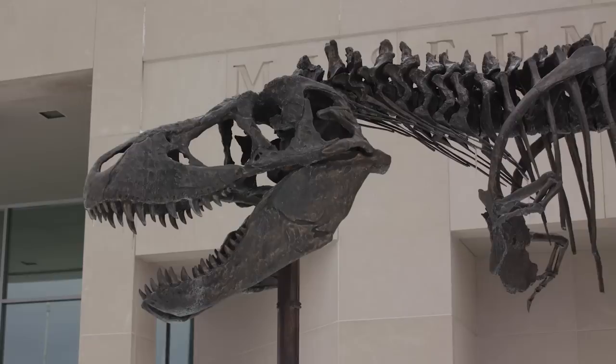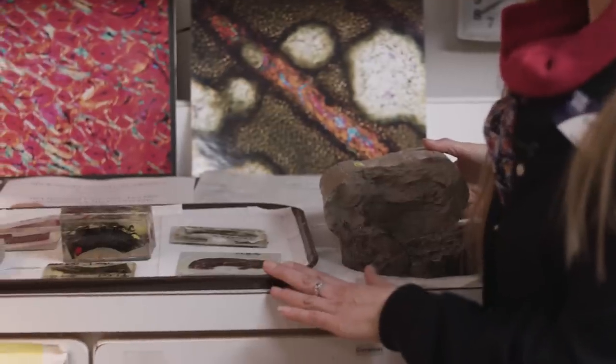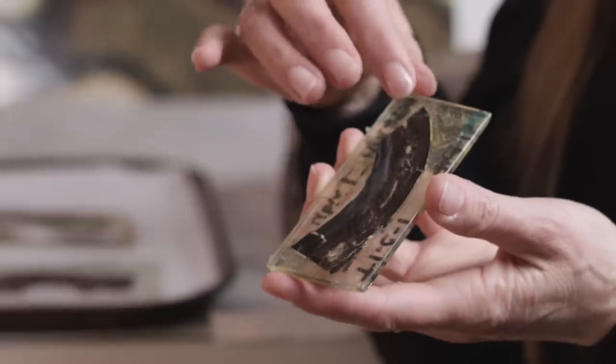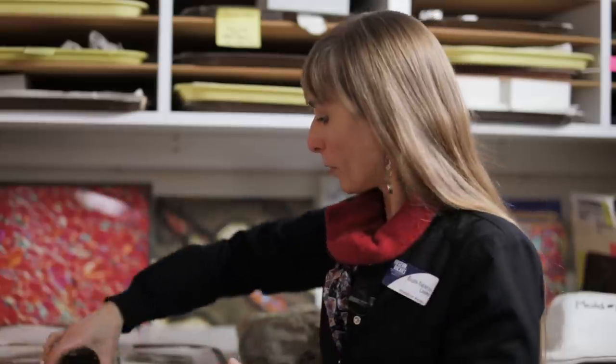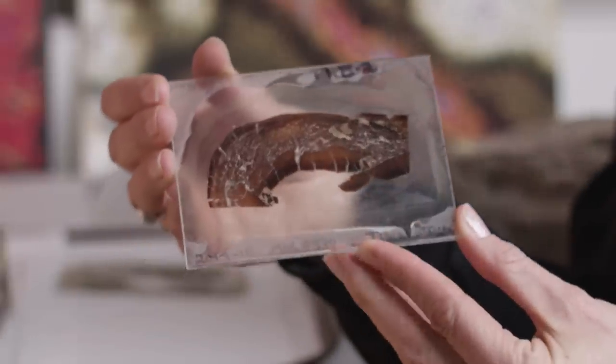One project Dr. Lam is working on is a study of how Tyrannosaurus rex grew throughout its lifetime. To get the closest possible look at the Tyrant King, she's prepared the tibia, or lower leg bone, of a T. rex found in western Montana. After the first cut is made on the saw, we expose the bone inside. This enables us to cut a thin wafer of bone, mount it onto a glass slide, and then I spend many hours at the lapidary grinder — generally listening to books on tape — until we get that hundred-micron thin wafer of bone. It's beautiful, and it's exquisite under the microscope. The science and the art are all blended together once we're there.